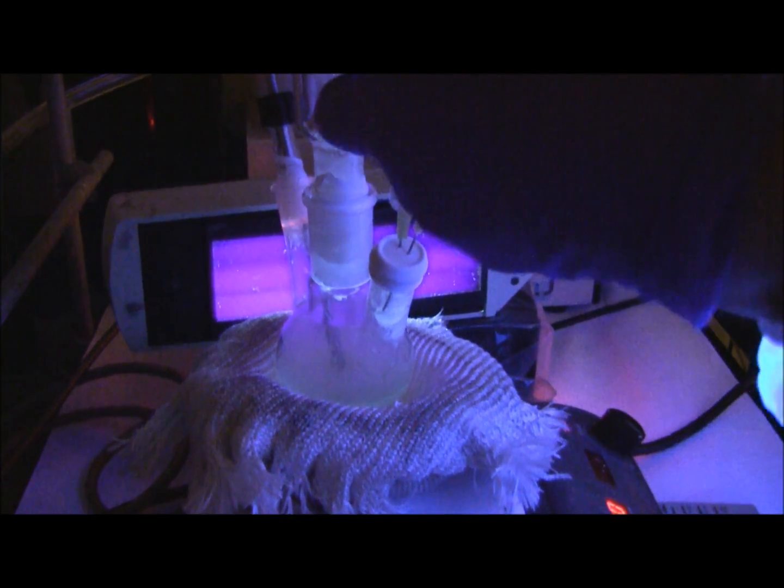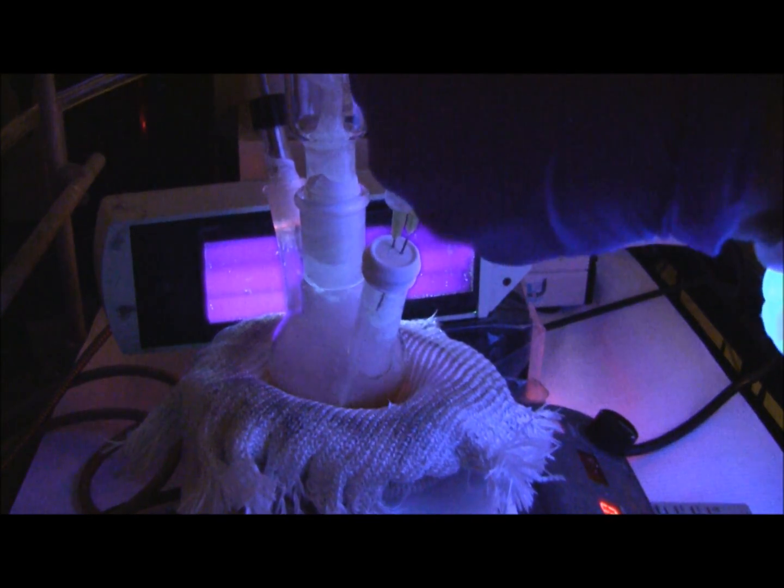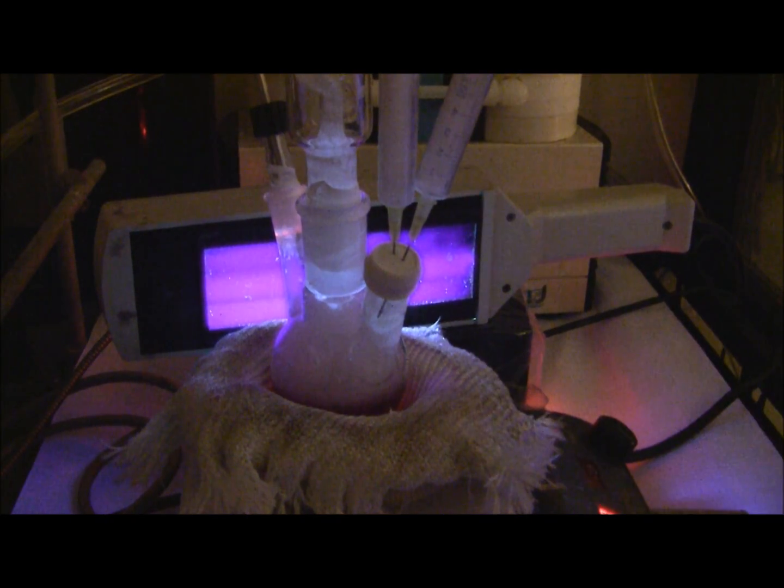Can you see? So now I am injecting the selenium and you can see the color changes immediately.